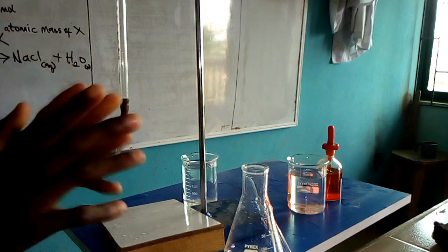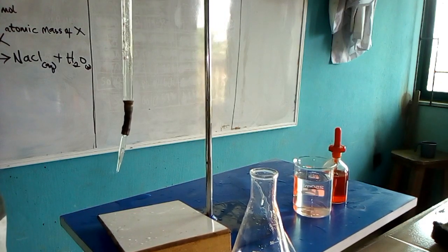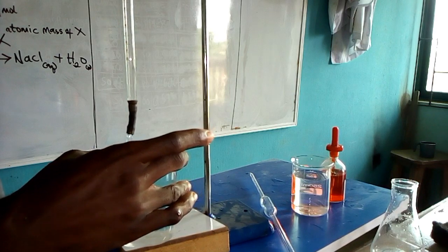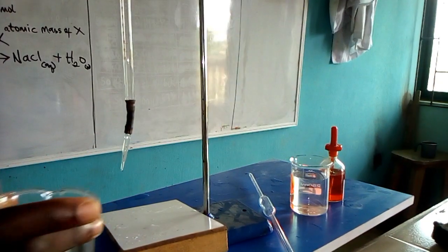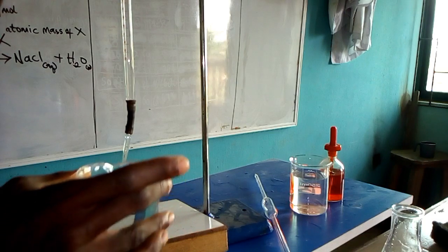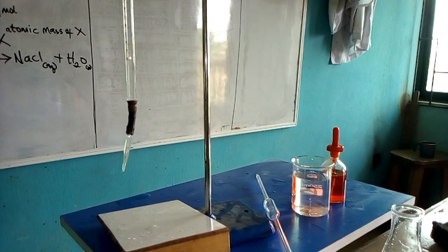Now let's perform the experiment. The first thing is to fill the burette with acid A using a funnel. Don't allow it to fall and dilute the solution. After filling the burette, remove the funnel to avoid topping up while titrating. Don't rinse the conical flask with any solution — rinse it with water and let it dry. Rinse the pipette and burette with the solutions they are meant to contain, to avoid dilution.